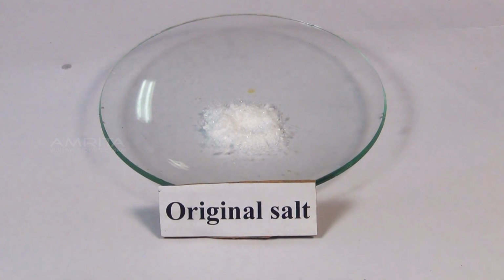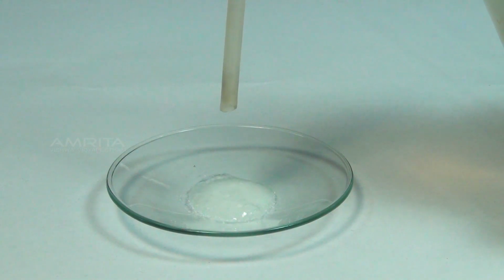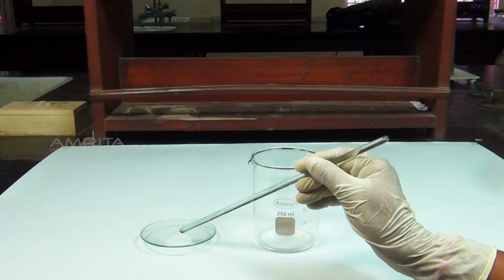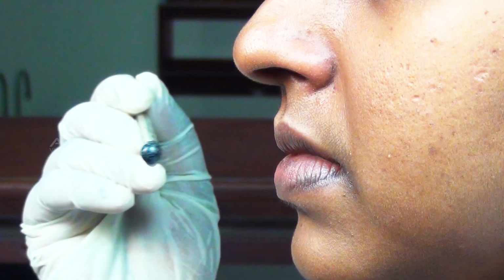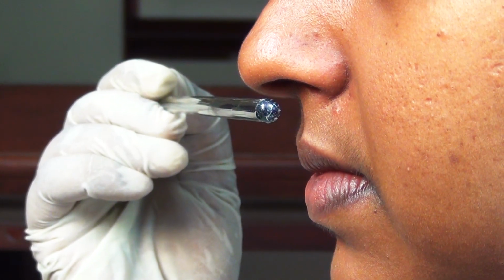Procedure: take a pinch of the salt in a watch glass. To this, add a few drops of distilled water. Now, take the glass rod and rub the salt with it and smell it. A vinegar-like smell indicates the presence of acetate. Dry heating test.